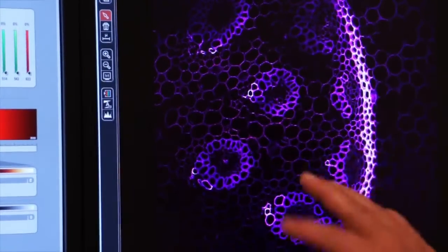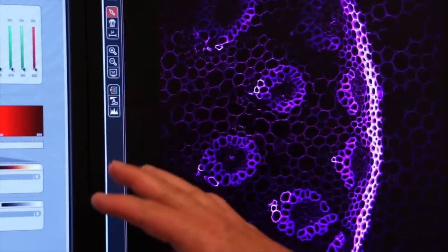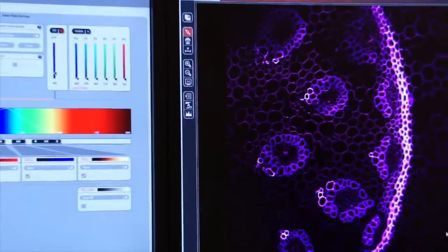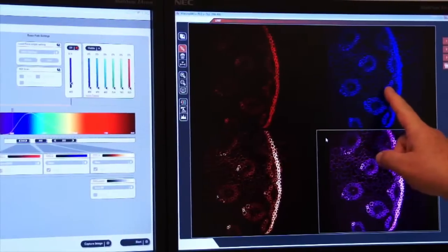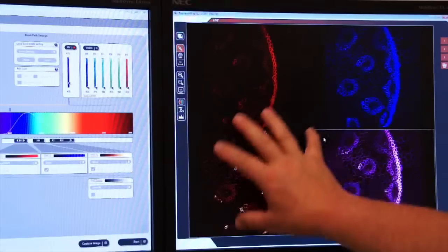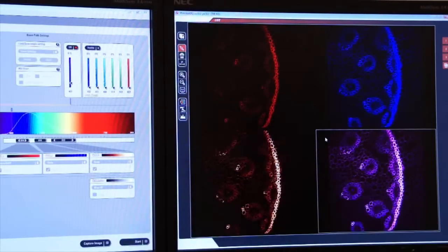So I can selectively choose a different color output that I want, even regardless of the area of the spectrum that I'm in. I'm scanning in a blue to green region of the spectrum, but I'm actually returning a red color. I could also return a yellow color if I want. Here I have sort of a brownish gold color. So I can choose the colors that I wish to have as output, irrespective of the area of the spectrum that I'm examining.